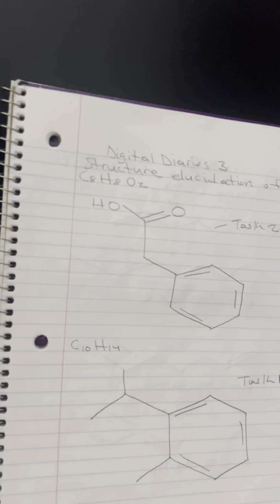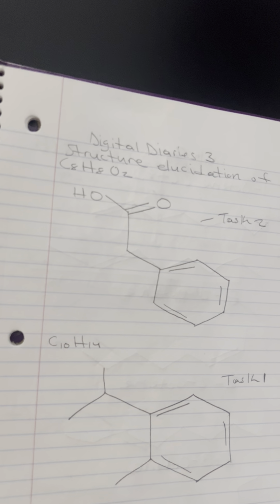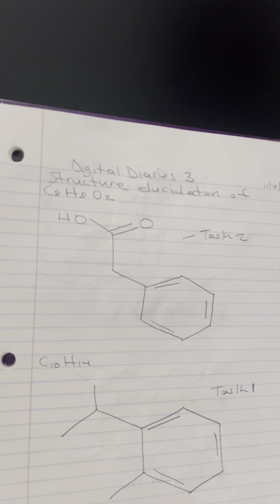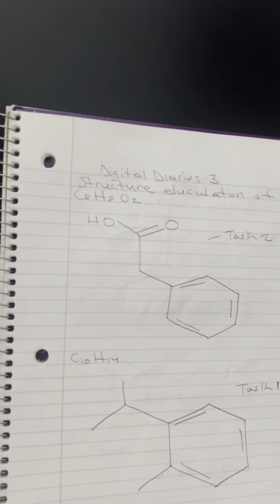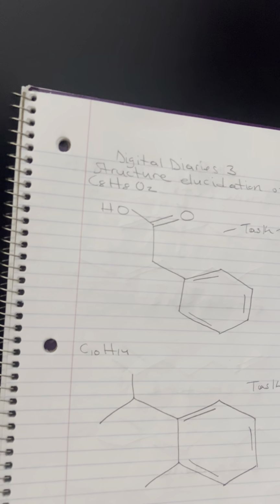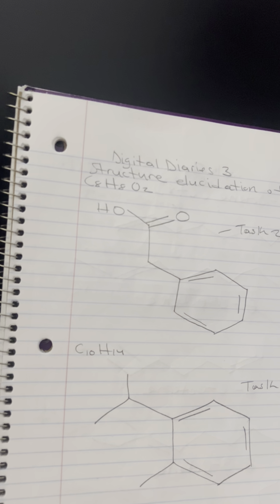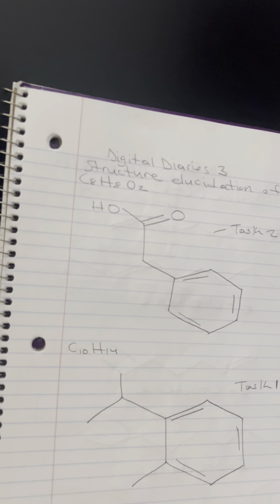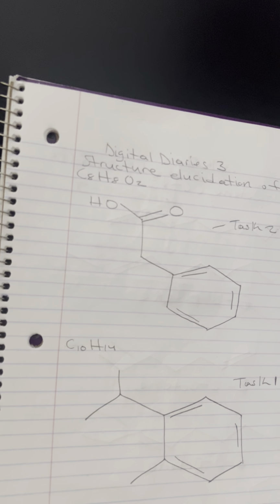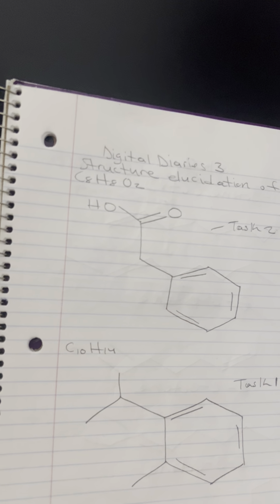So match peaks to functional groups. If I look at the major peaks in the IR spectrum to assign functional groups, a strong peak around 1700 cm-1 might suggest a carbonyl group, and the broad peak around 3,200 to 3,600 cm-1 could indicate an OH group.